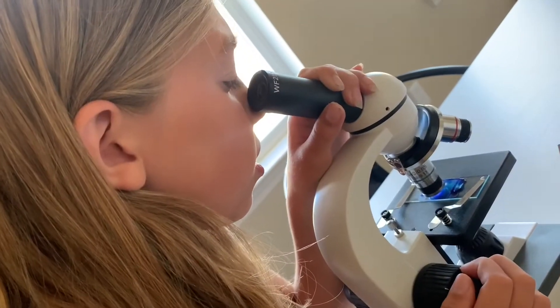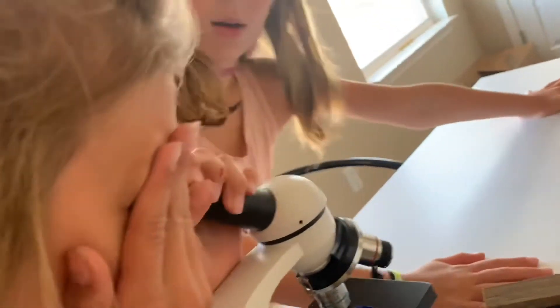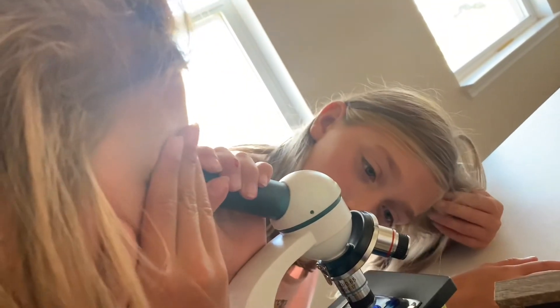That's weird. What? Let me see. Look — there's like some kind of hair or something. Oh, there's an eyebrow touching it.